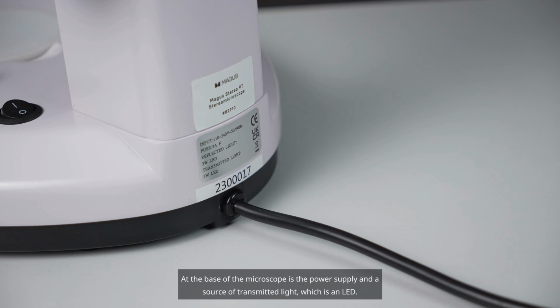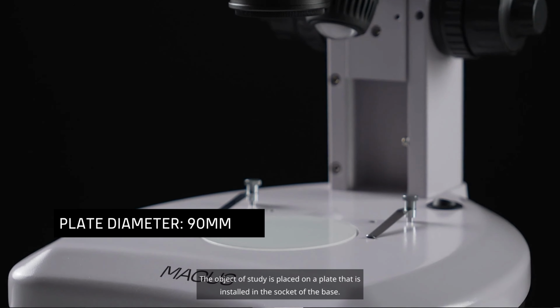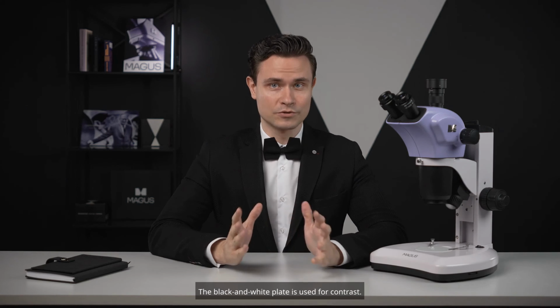At the base of the microscope is the power supply and a source of transmitted light, which is an LED. The base also serves as a stage. The object of study is placed on a plate that is installed in the socket of the base. The diameter of the plate is 90 millimeters. The set includes 3 plates.